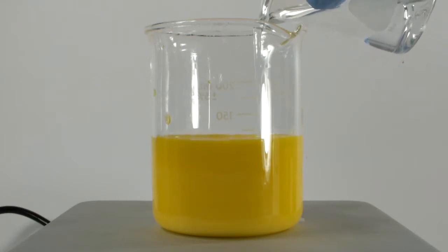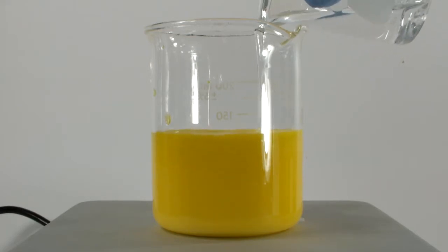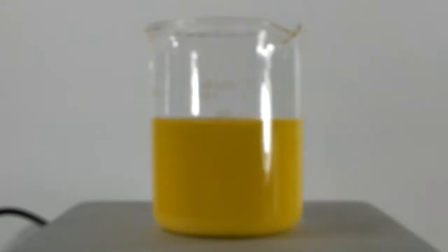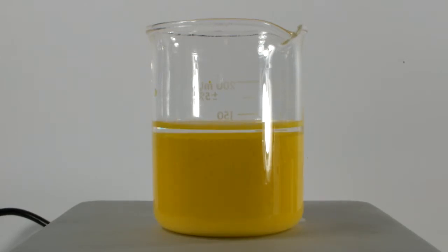That way, once I recover the lead chromate, I'll only have to treat the resulting solution as lead waste. I let it stir for a while to make sure that the reaction went to completion, and as soon as I stop the stirring, you can see how quickly the lead chromate falls. This is about half a minute later, and you can see that the top layer is completely colorless, which means all of our chromium is reacted. That's good.